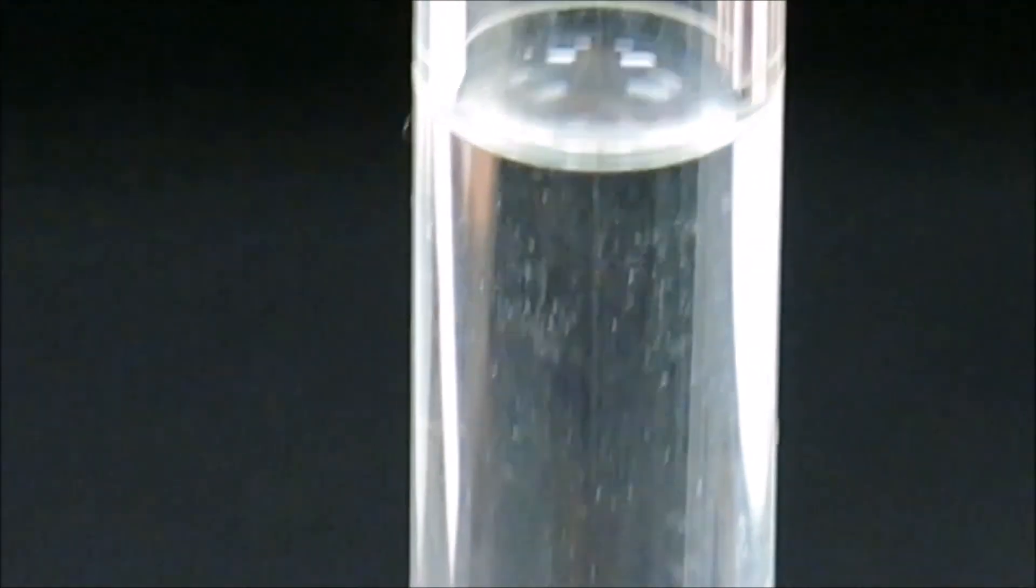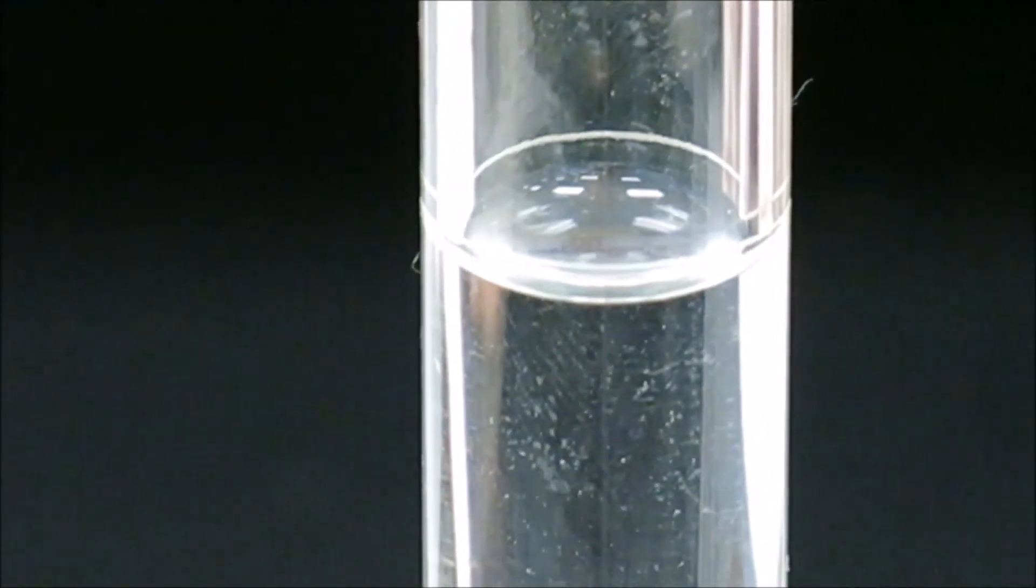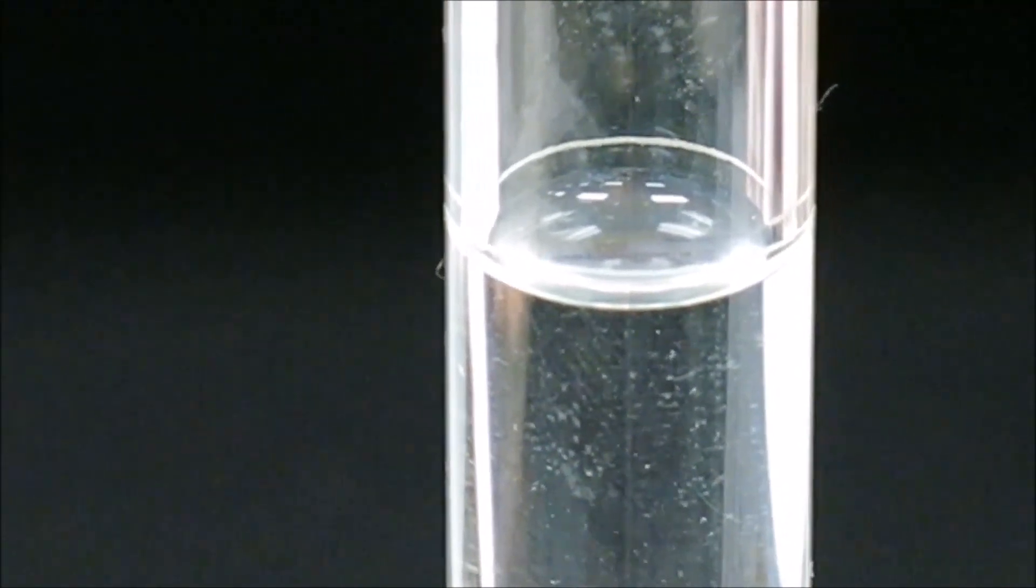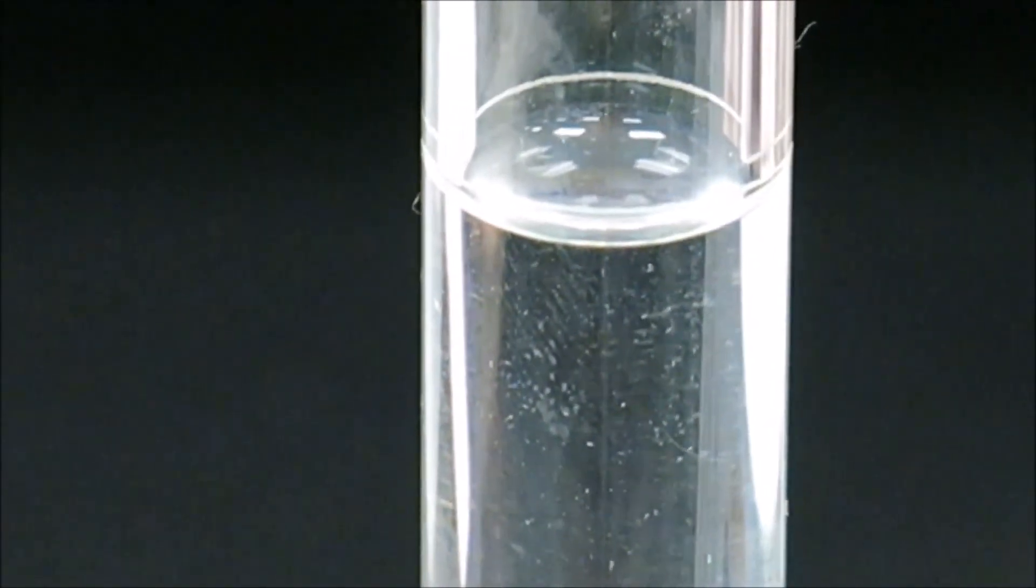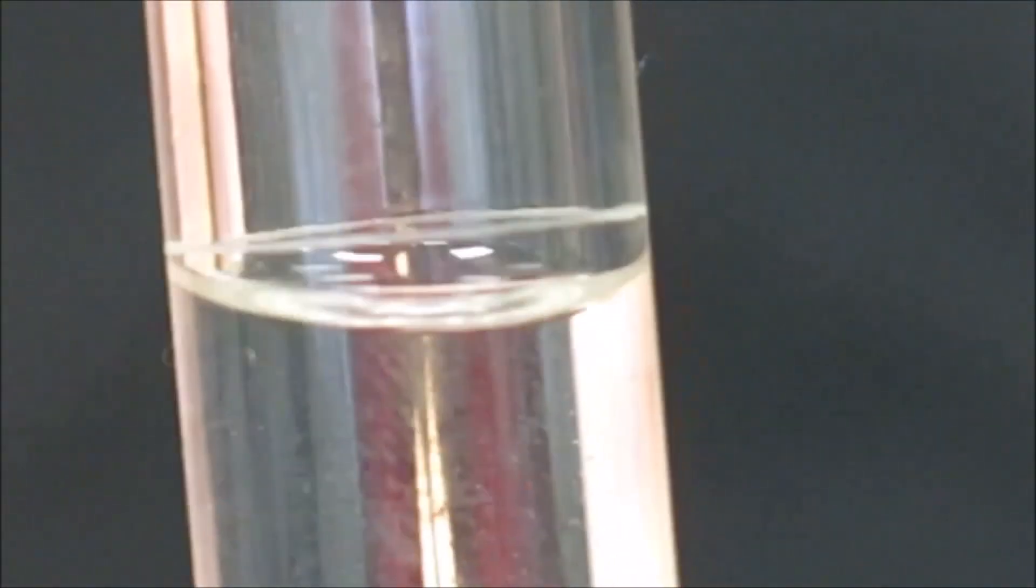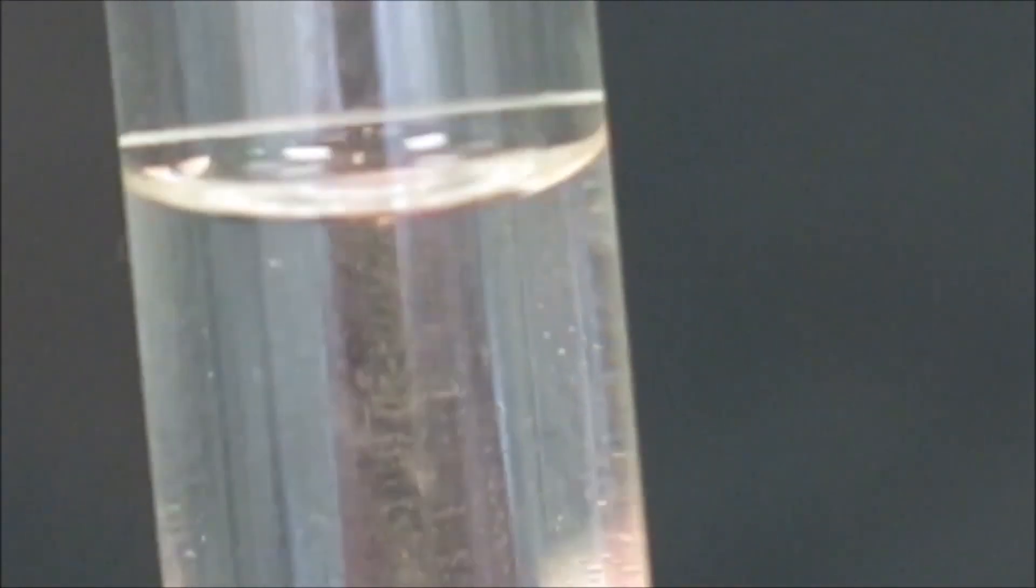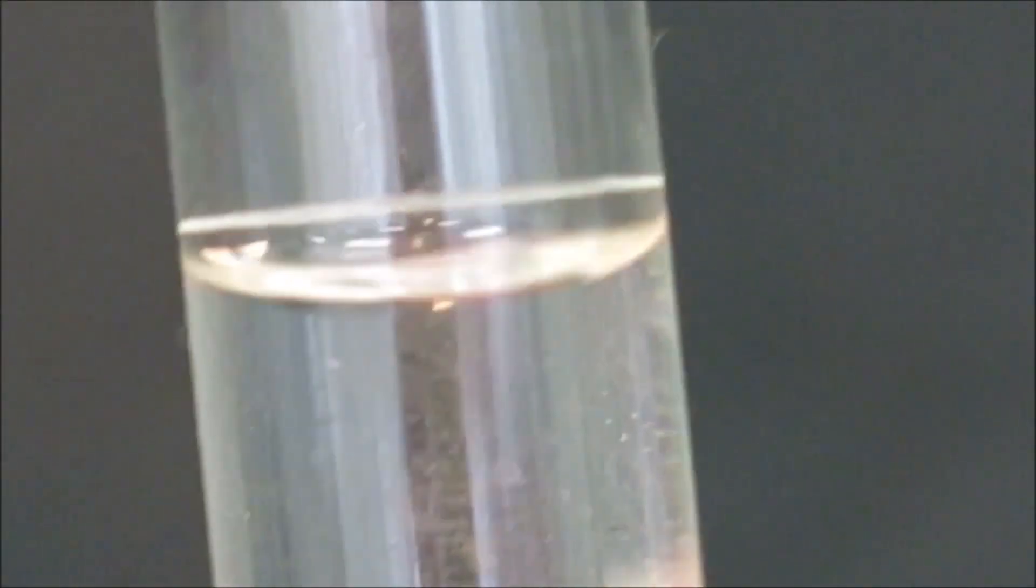We can see the front line is right where the bubble of the water is, but the back line is still very visible. This shows parallax. As we bring the camera lower or the flask higher and approach the two lines until there is one line, we can see the level of fluid is below the line. Even though the top seems to be at the line, the bottom of the bubble is not, which shows we're not yet at exactly 100 milliliters.